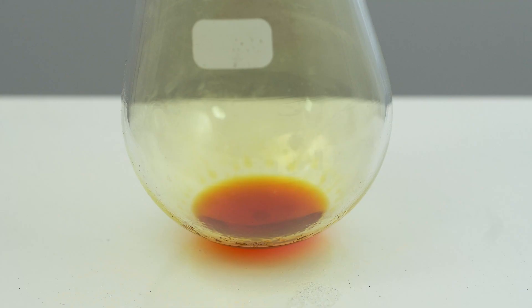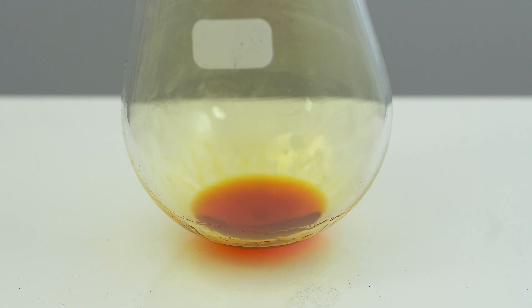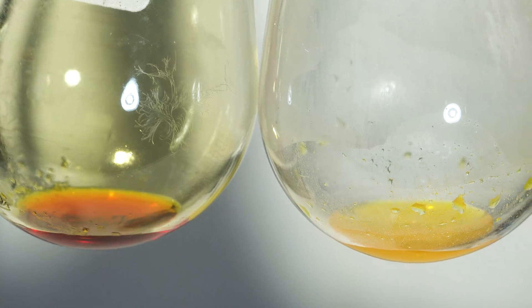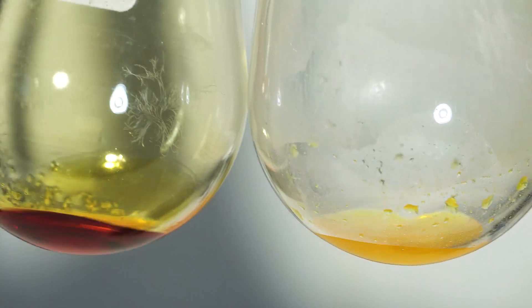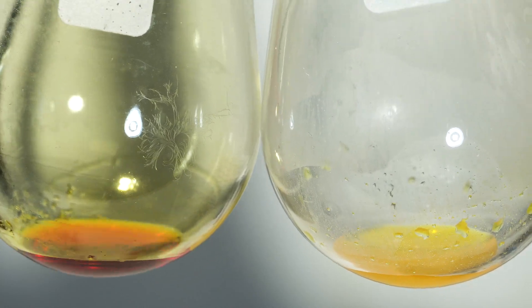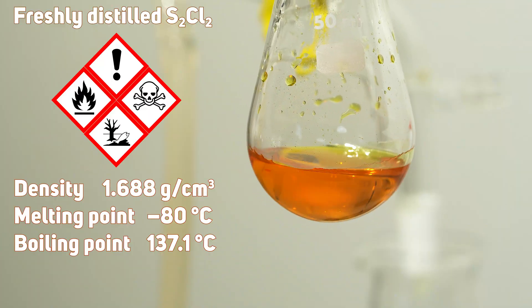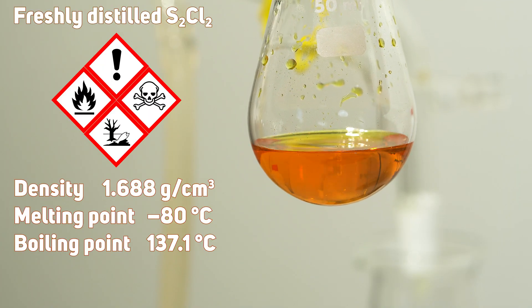For comparison, I show you two samples: the disulfur dichloride we just obtained with an admixture of sulfur dichloride, and to the right of it, the freshly distilled disulfur dichloride. This is what fresh, pure disulfur dichloride looks like without any impurities.